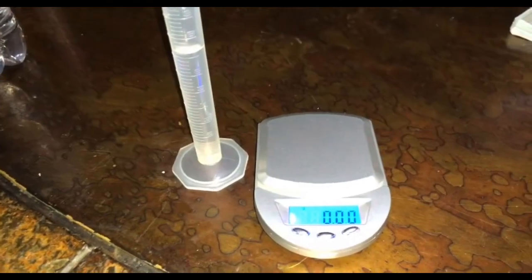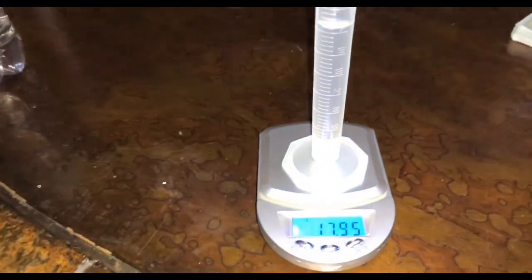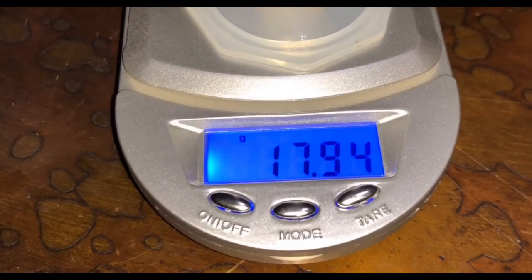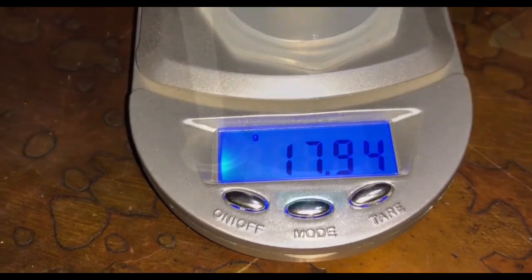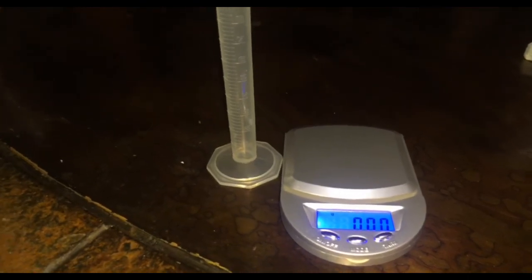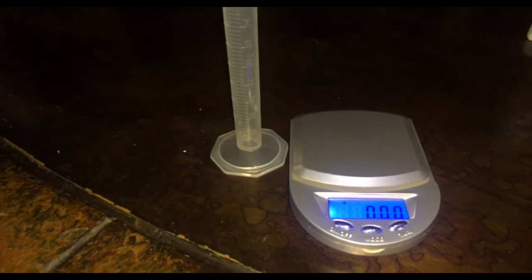The next step would be to stabilize your balance at 0.00 and put on your graduated cylinder with the 7 milliliters of water and measure the mass in the table given in your lab manual. Next step will be to repeat the process with the 10 milliliter graduated cylinder and also balance and water. You will need those measurements for your table.